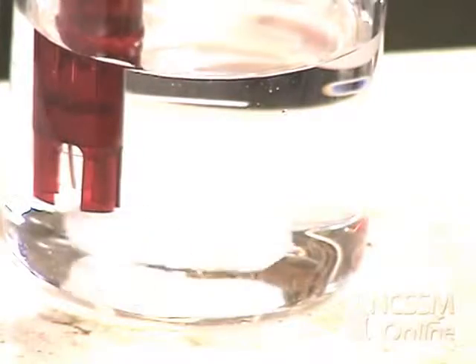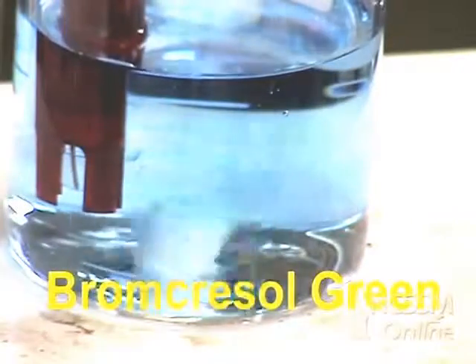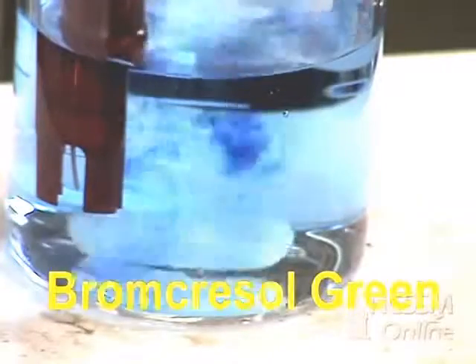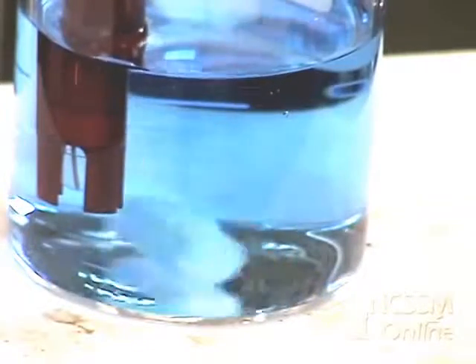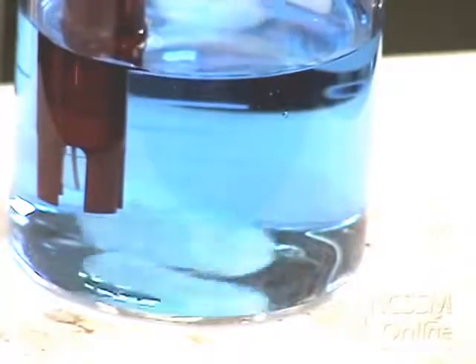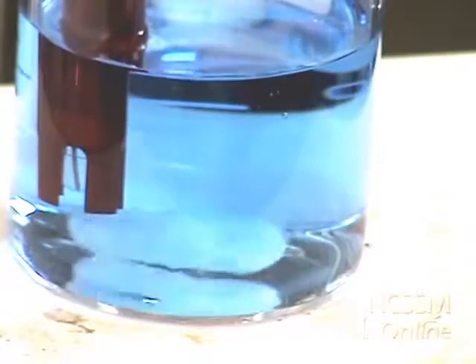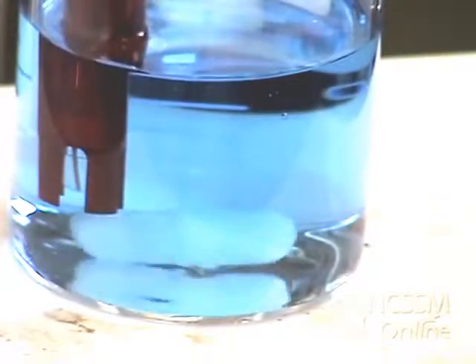When the phenolphthalein has turned colorless, you now want to add 3 to 4 drops of bromocresol green. Bromocresol green turns from blue to yellow at a pH of about 3 to 4. You want to continue to add the HCl solution in 1 milliliter increments, collecting data each time. Record the volume when the indicator changes from blue to yellow.